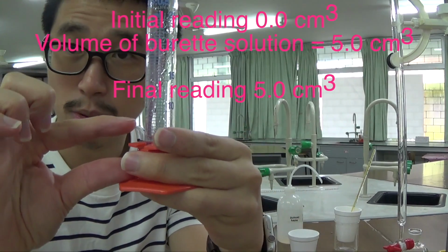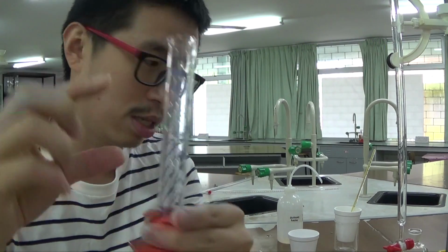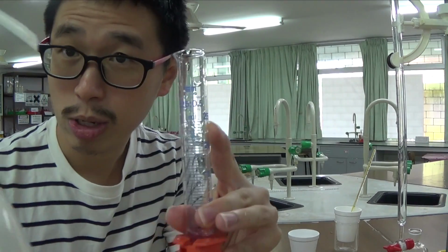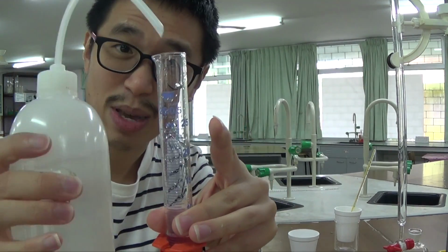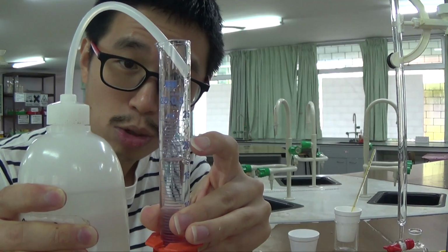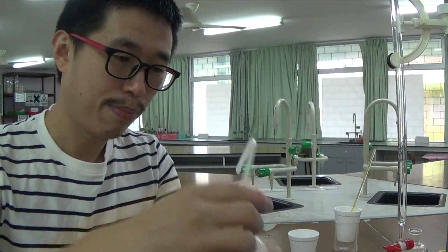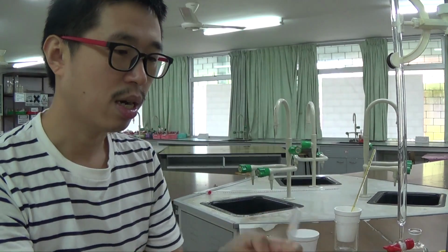I have 5 cm³ of that from the burette, and I have the remaining 20 cm³, which is just distilled water. When I add distilled water up to 25 ml, I do not want to squeeze it all the way until 25 ml. I want to squeeze in so that it's fast, but when you reach around 20 something, do not go fast. Instead, open the bottle and start using a dropper.